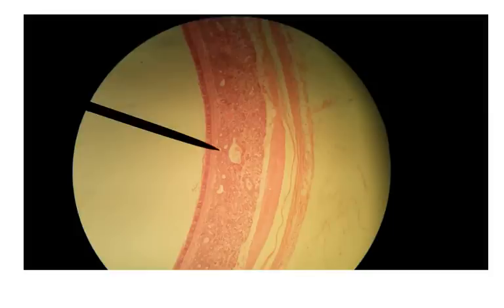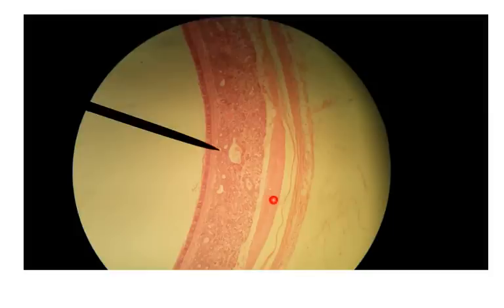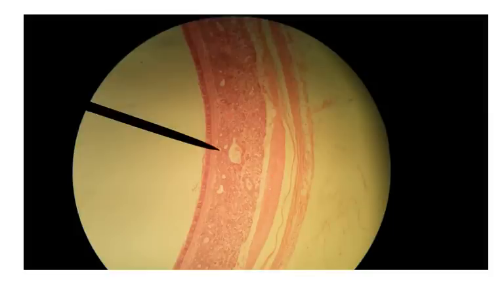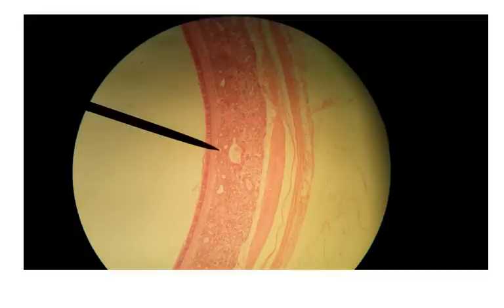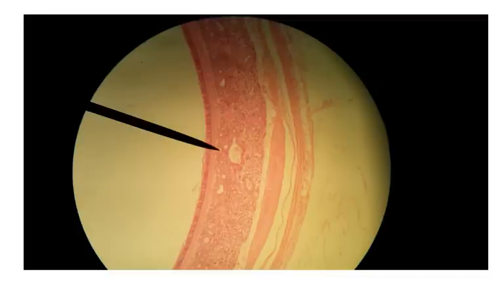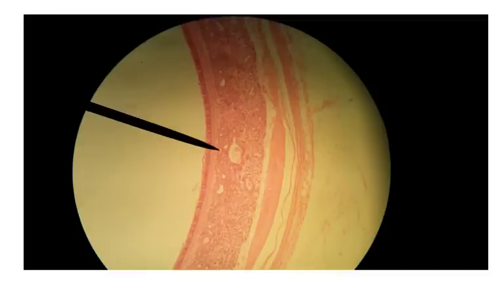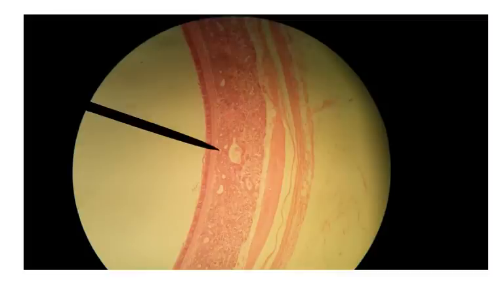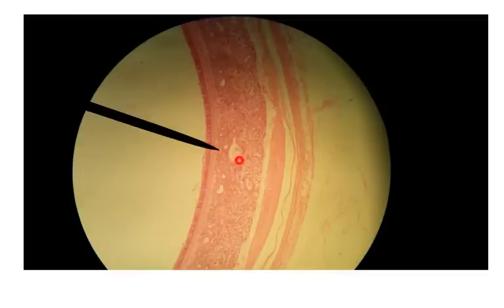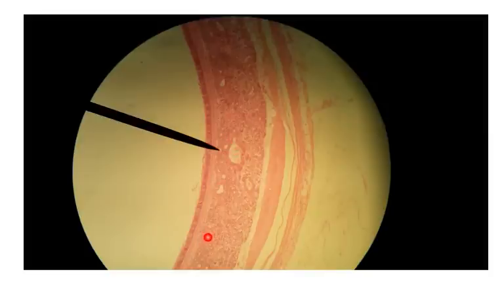The posterior part of the trachea — the C-shaped cartilage rings don't meet in the back. That's where the esophagus comes close to the trachea, and when you swallow food you need your esophagus to be able to expand. So in the posterior portion, these C-shaped rings do not connect.